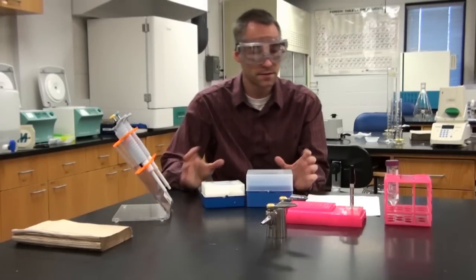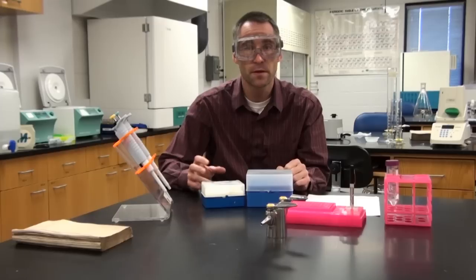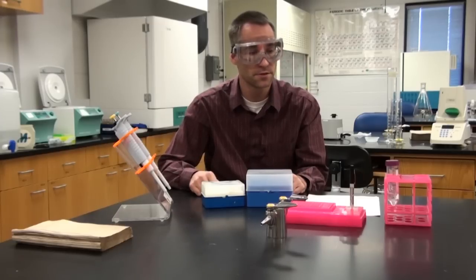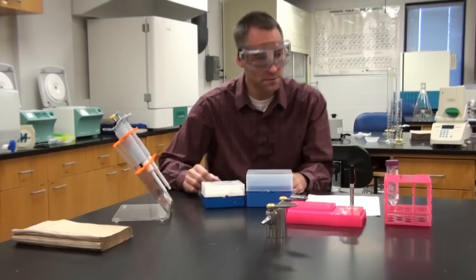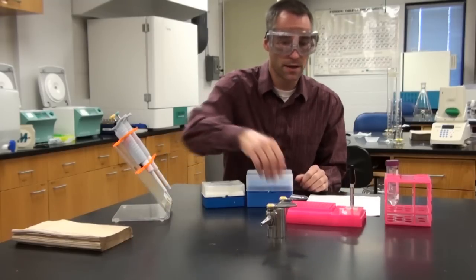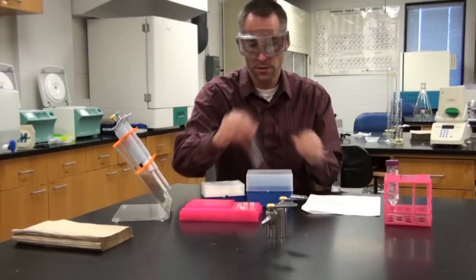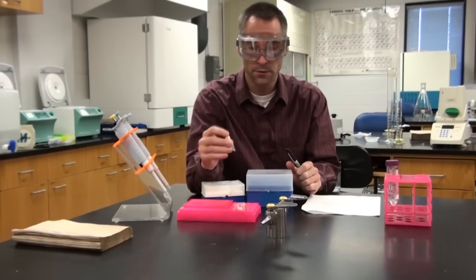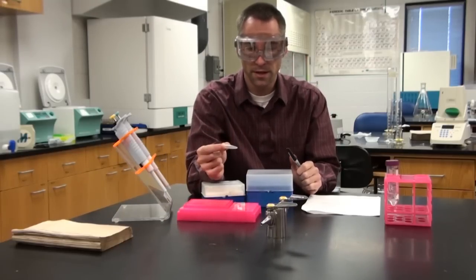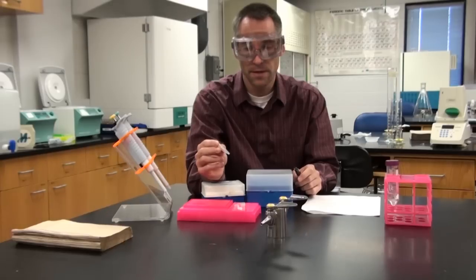What I want to do in this video is introduce you to some of the equipment and some of the procedures that you'll be using in your PV-92 PCR lab. So here's the equipment. Just to give you an idea of what you're going to have, you should have at your position a rack that should have a tube with a screw top.